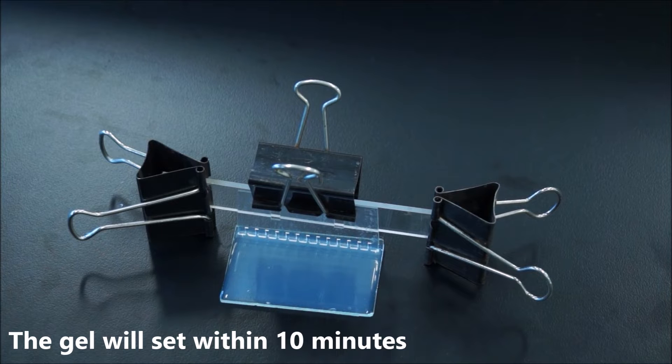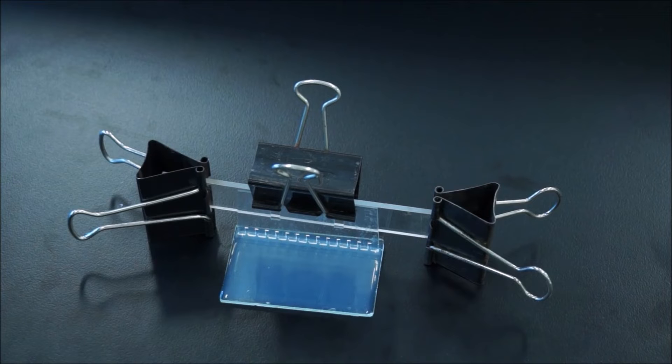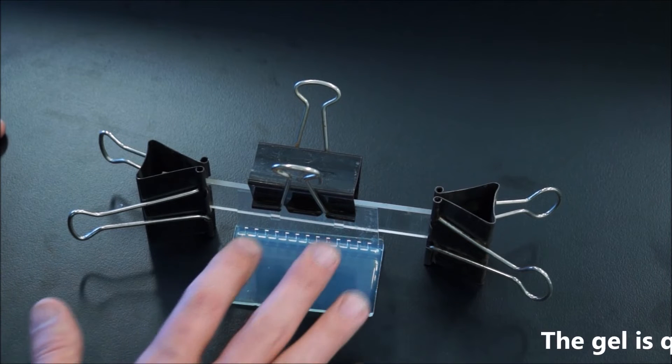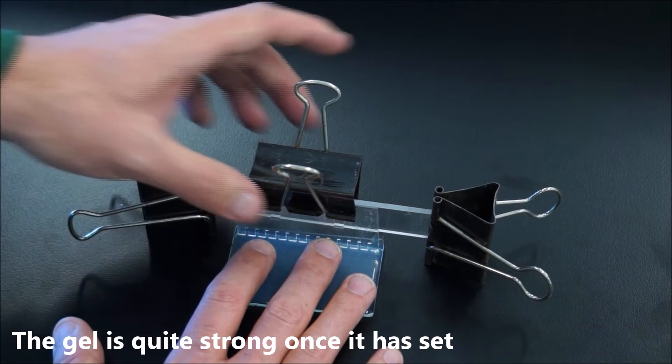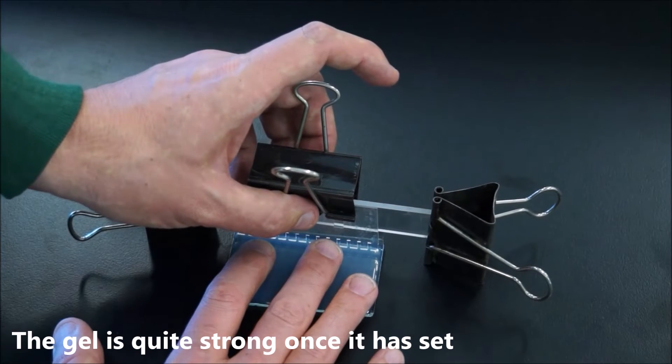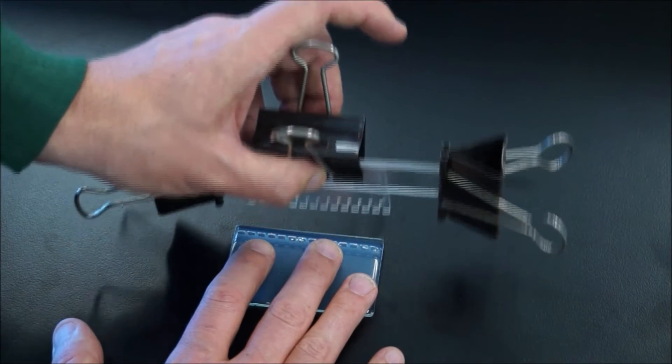Once at least ten minutes have passed, you can pull the comb out of the gel. It will have set by now. To do that, it's really quite easy. They're robust. Put your fingers on top of the gel and just pull this straight up.